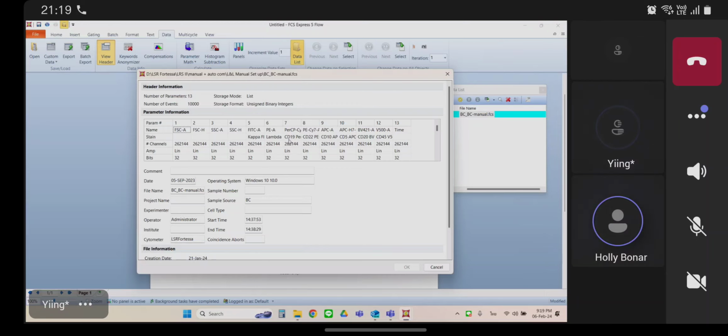Oh, okay. So your parameter numbers have to match every time. I don't know if, when you exported it, you didn't export the width this time, or I'm not sure what happened with this data set. But once you fix your LSR2 template to accommodate the files with that number of parameters, then those data files always have to have the same number of parameters. Otherwise, it's not going to populate correctly. Does that make sense? You can't go between different data sets. Otherwise, it's going to look exactly like what you have.